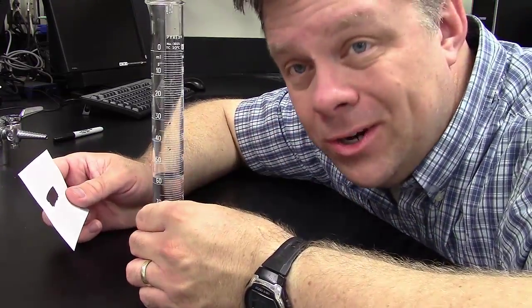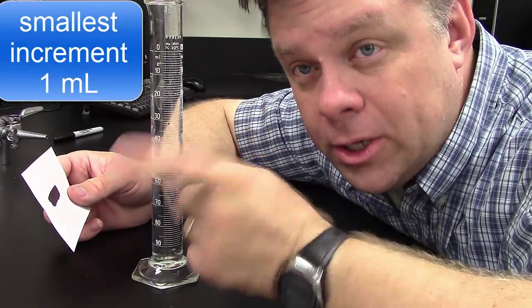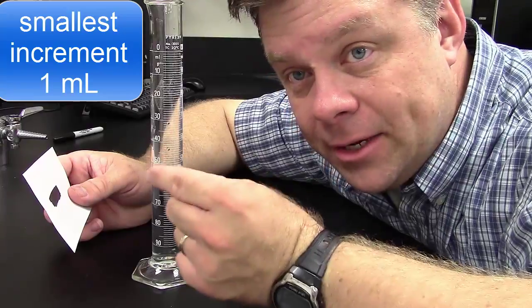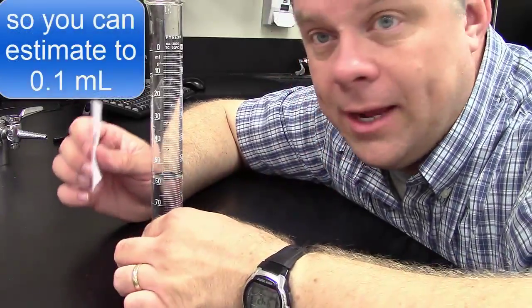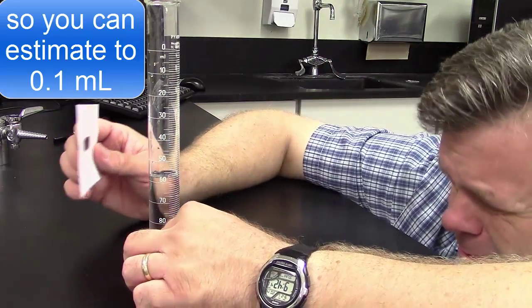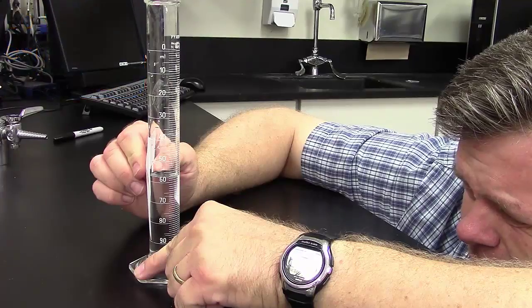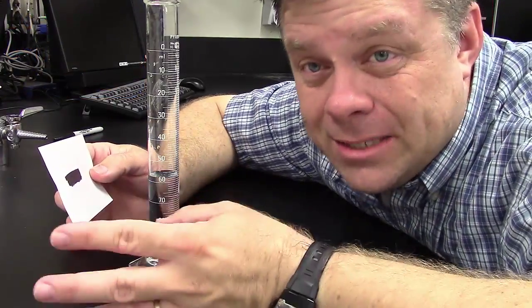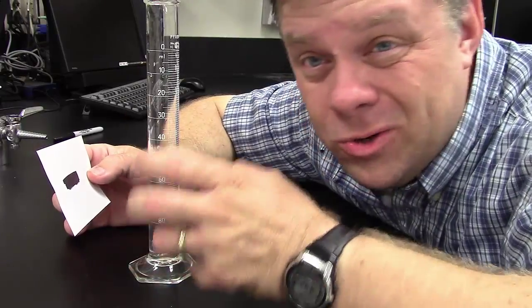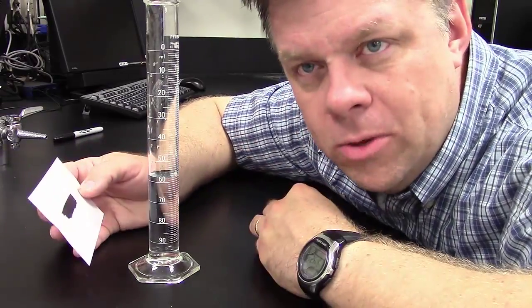Again, always look at your increments. The smallest line in this one represents 1 milliliter. So I can estimate a tenth of that increment, so I can estimate to the tenth spot. So again, line it up, get down to eye level, double check. Yep, sure enough, should be 41.7 milliliters. Remember, that last digit is an estimate, so even if you come back one or two times, you might vary a little bit in that last position. That's okay though, because it's a measurement, and there's always going to be human error.